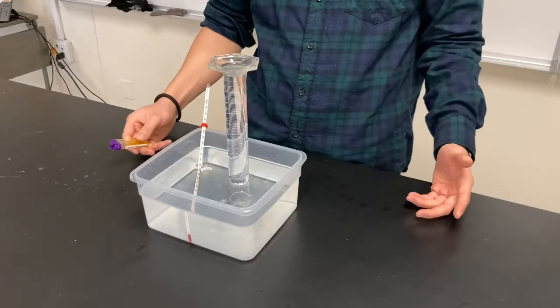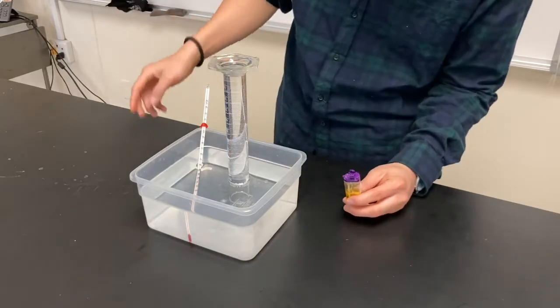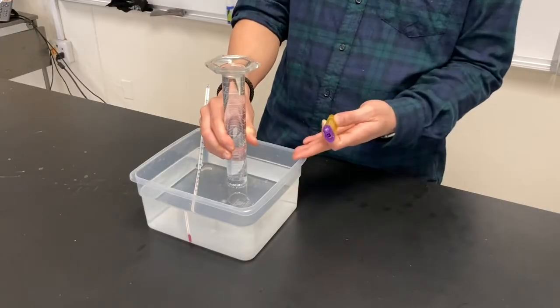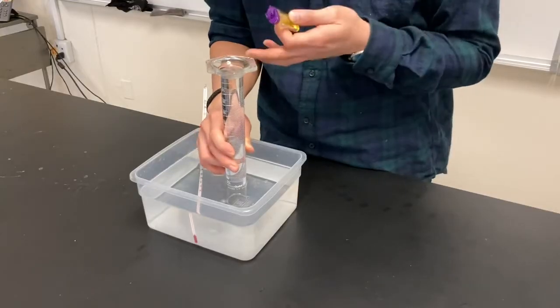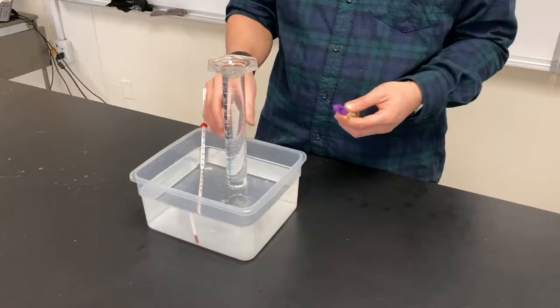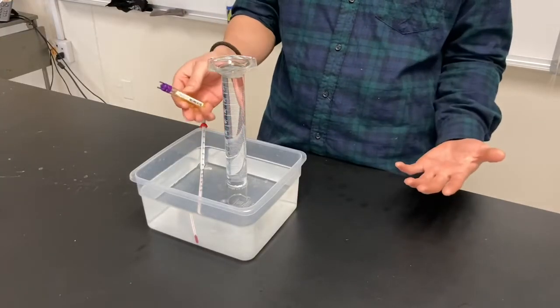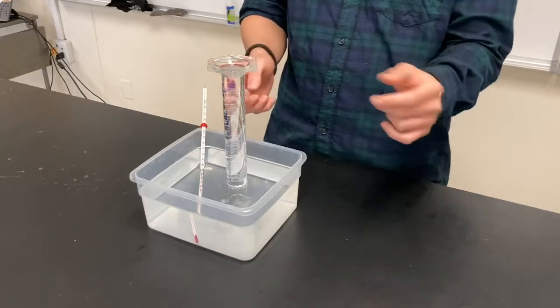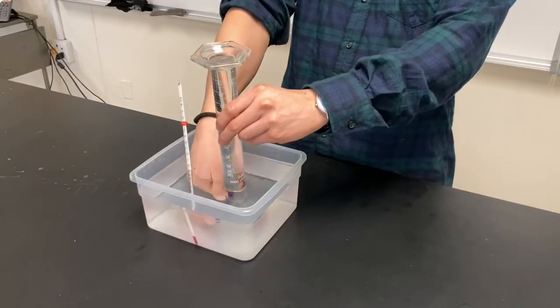Next I'm going to do the main procedure of the lab — collecting butane gas in the graduated cylinder. I've filled the graduated cylinder completely and inverted it over the water, so it's all filled with water. There is a little air bubble in there, which happens sometimes. This air bubble could affect my data because now I'm not just collecting butane — I'm also collecting a little bit of air. I'm going to put the lighter under and collect the gas.